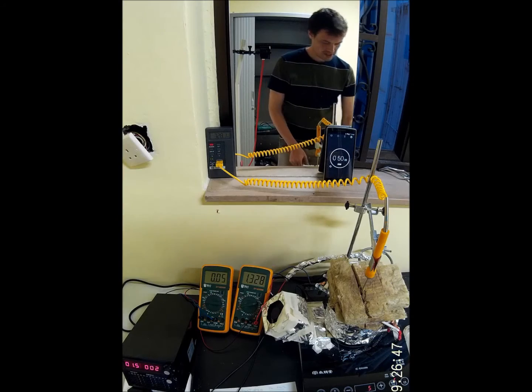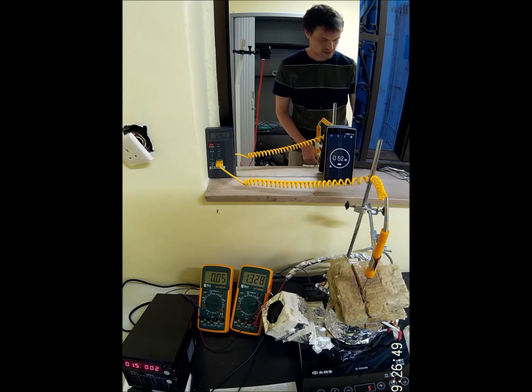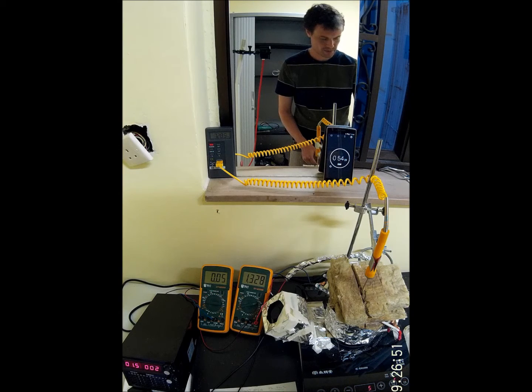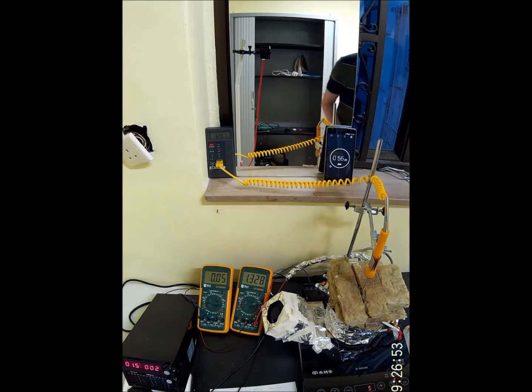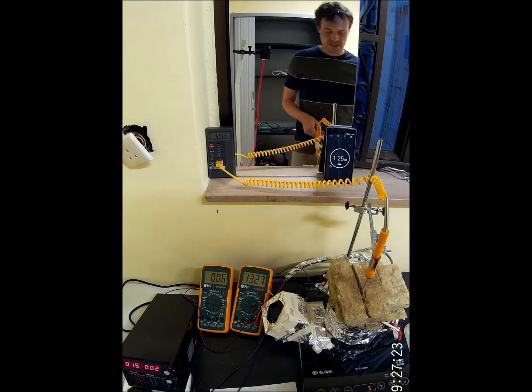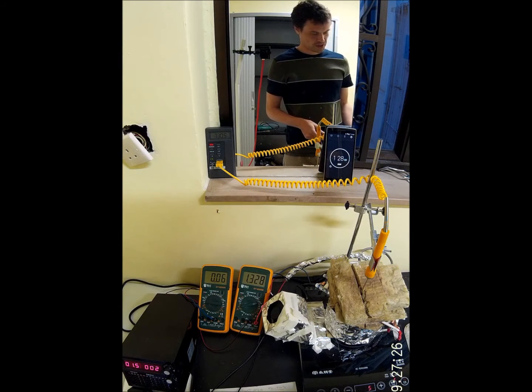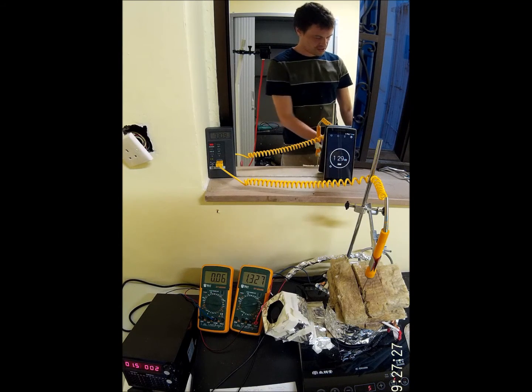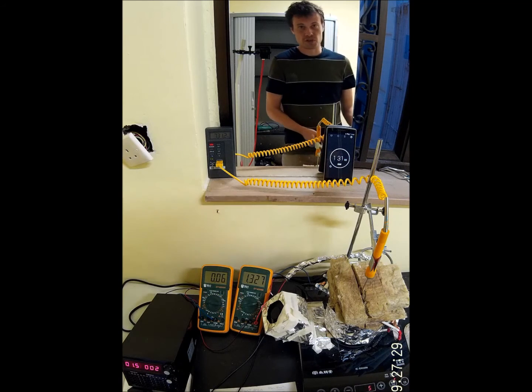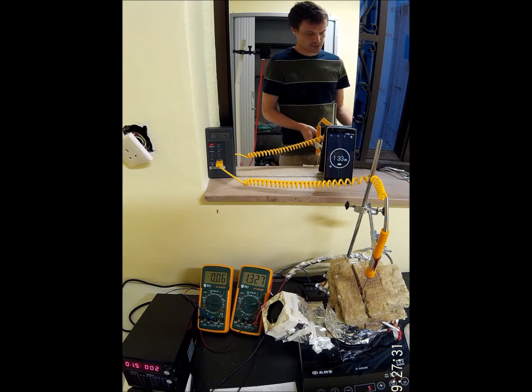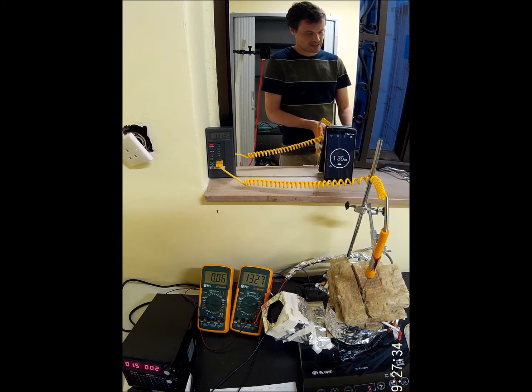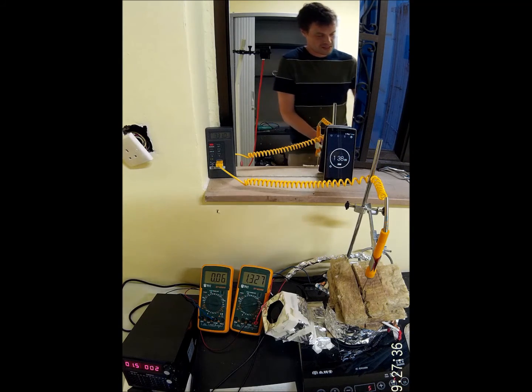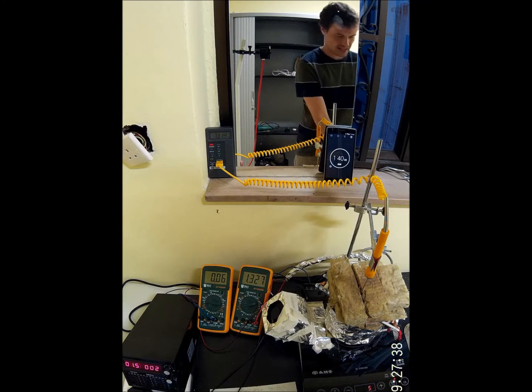Okay, let's take a look still at the cooling cathode. The porcelain chopsticks have excellent thermal shock resistance. I just took it out from the hot oven and directly to the cold and still intact.